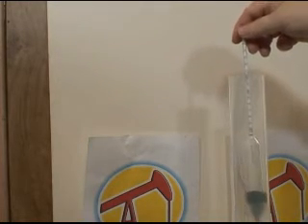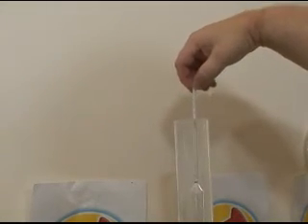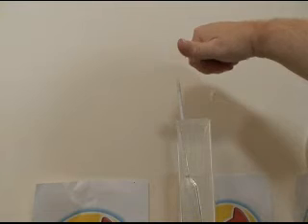This cylinder contains a sample from my drum of methanol. To perform the test, drop the hydrometer into the methanol. To be accurate, we need to spin the hydrometer to remove any air bubbles that might alter the reading. We also need to make the reading when the hydrometer is not touching the sides of the cylinder.